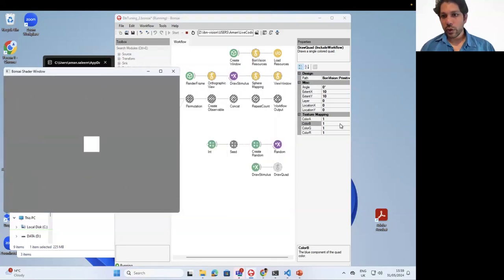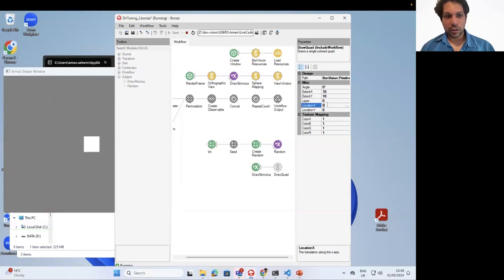Now we want to move this square into the corner of the screen. So how do we do that? Let's move it to the left bottom, so minus 20. I need it further. That's too much. Okay, and now I want to move it lower. Should be minus 40, I think. Not too much. All right, so we've got this square. You can see that the square is a bit distorted, and that's because it's adapted depending on the position on the screen. We can avoid this, but I'm not going to do that at the moment.